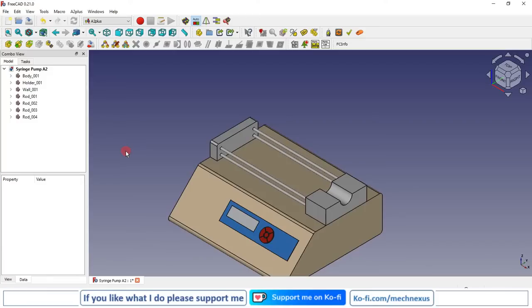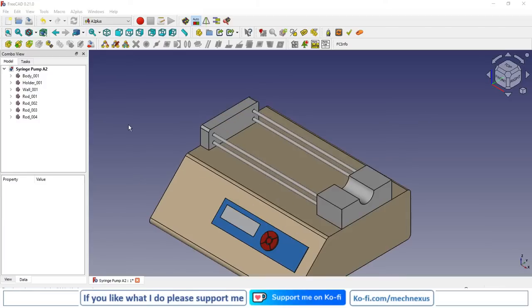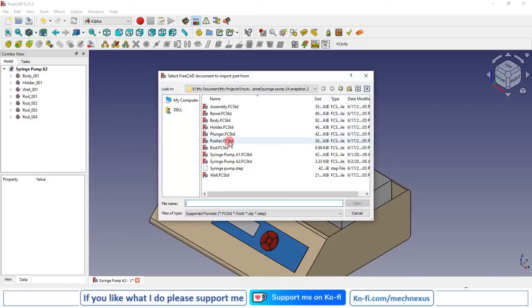So you can see that it is very similar to SolidWorks or Autodesk Inventor. If you have used those software, A2 Plus is very easy to use. Now our next part is a pusher. Next part we are going to assemble this pusher. So I will click on add part and I will select the pusher.